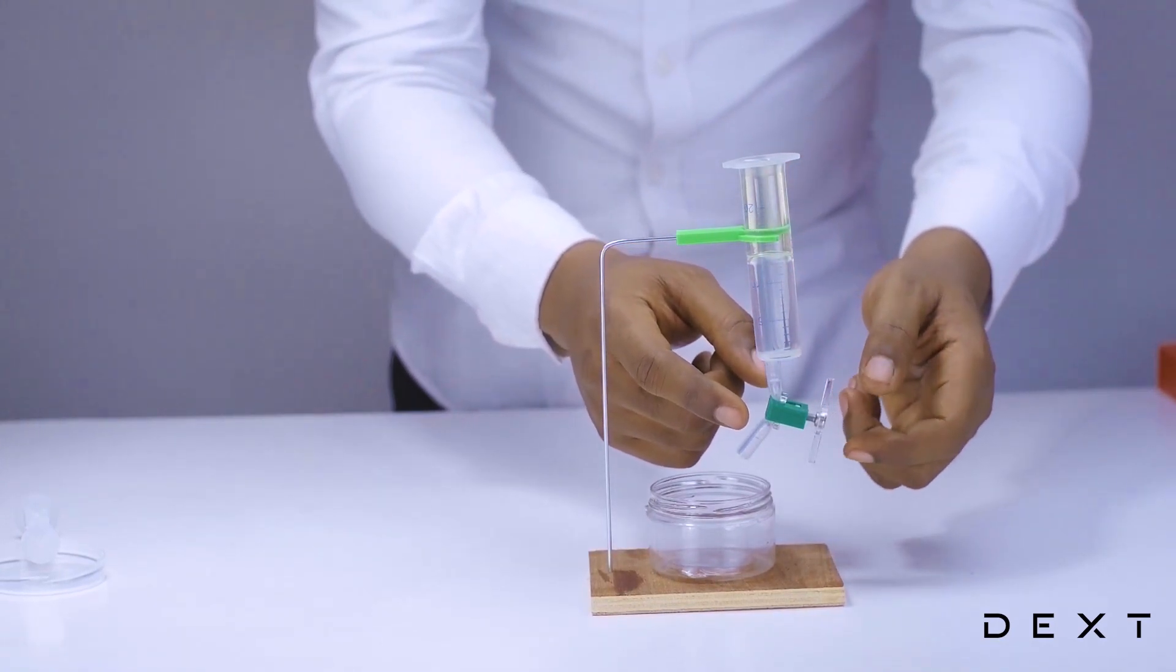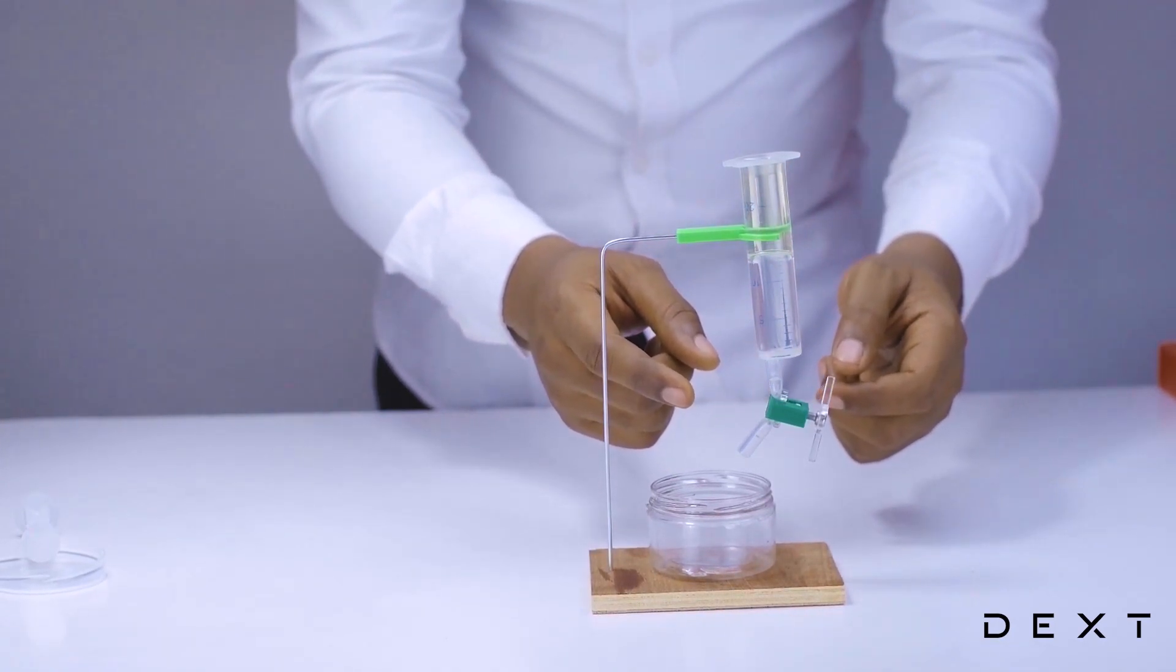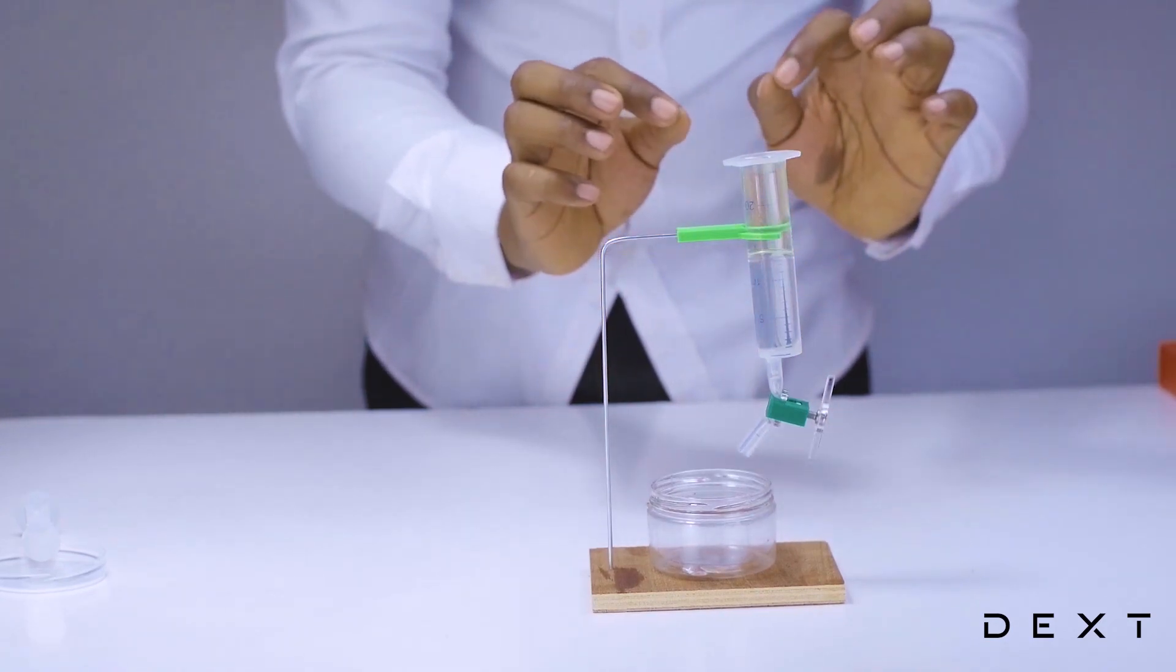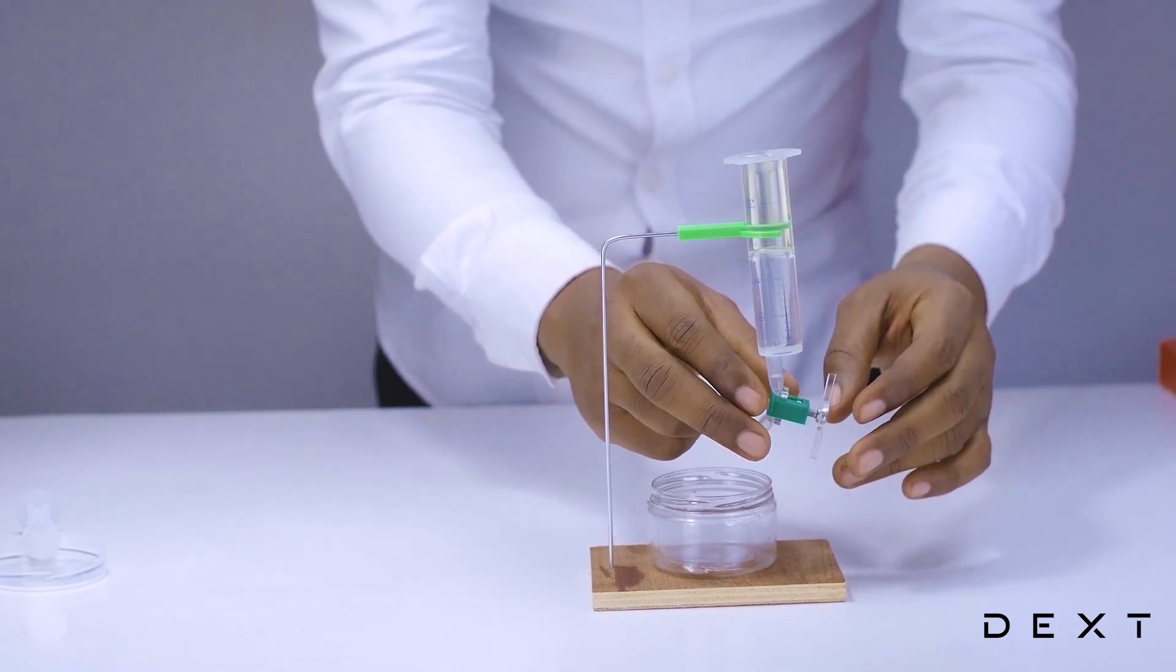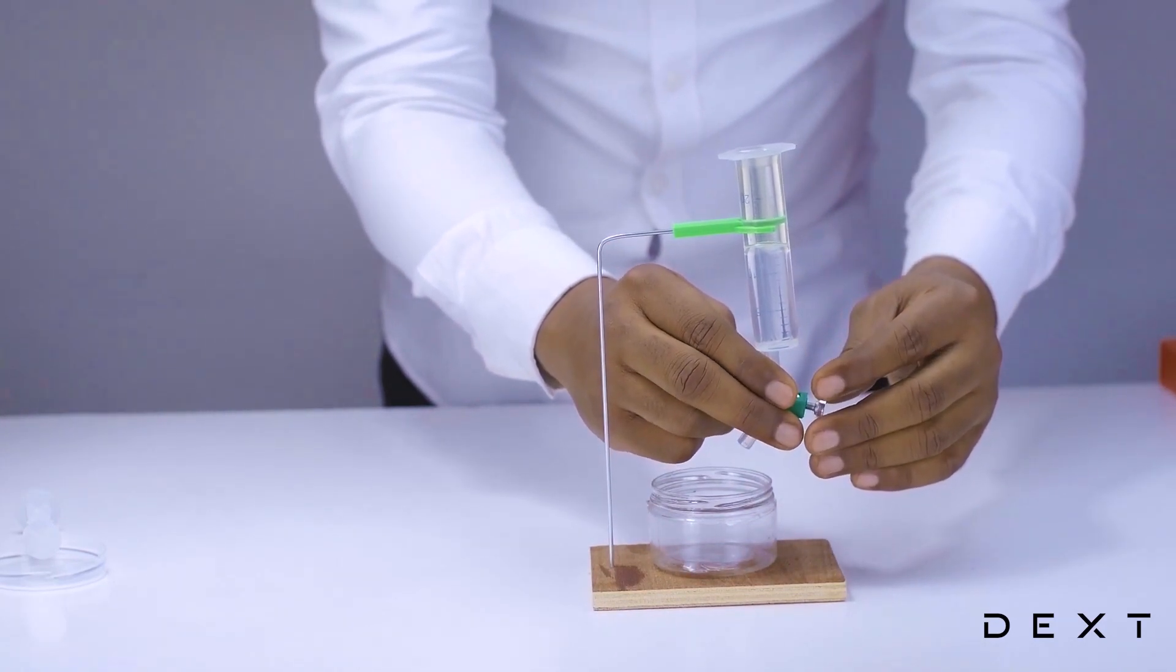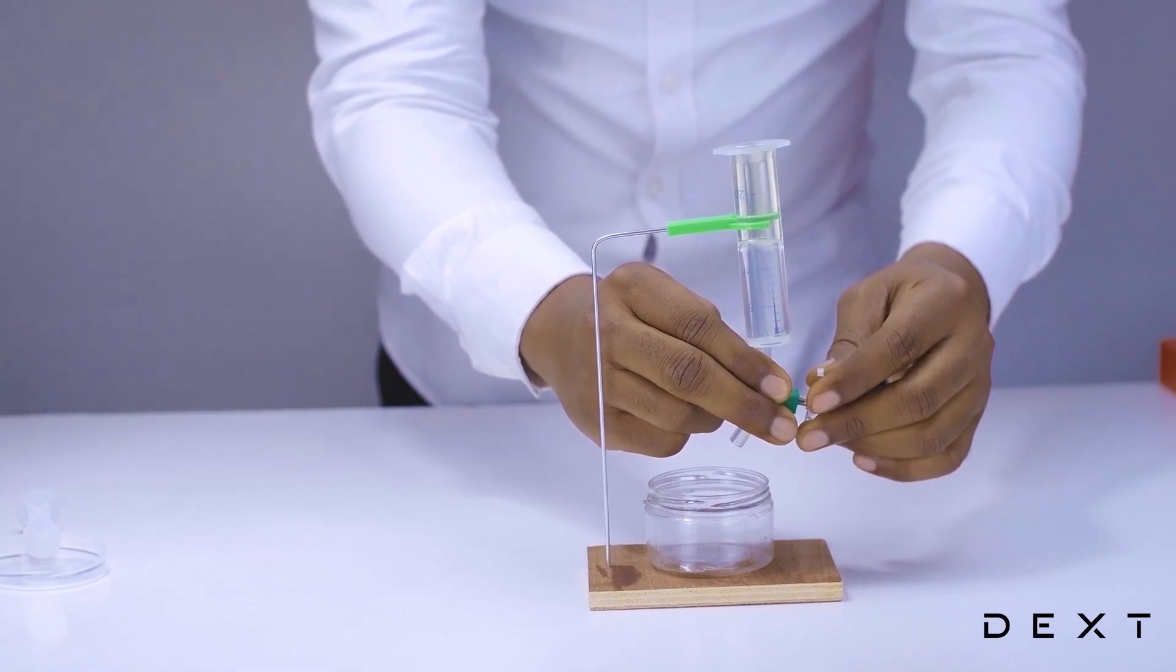Okay, so after you have left your setup for about 15 minutes, you are going to gently open your tap until you see the liquid at the base, in this case the water, starts to drip.